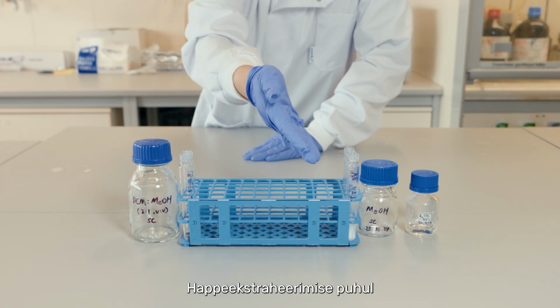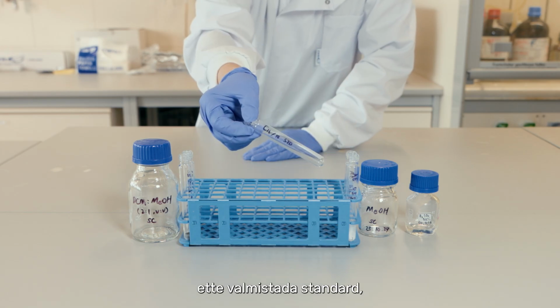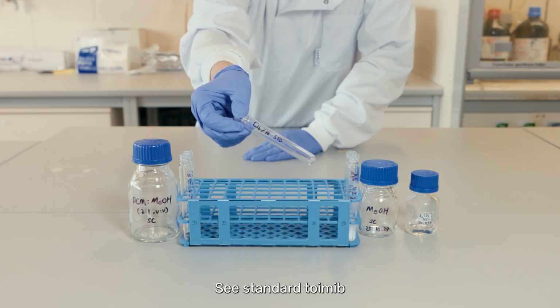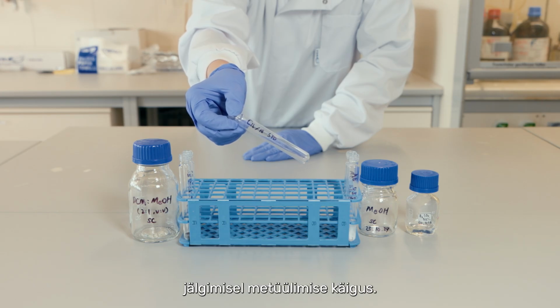For acid extraction, apart from the sample and blank, we need to prepare a standard which contains palmitic acid and stearic acid. This standard will work as a reference to track the change of carbon isotope values during the methylation.